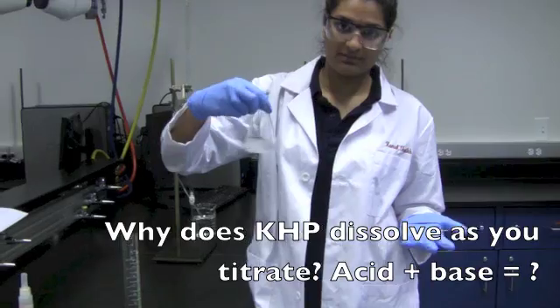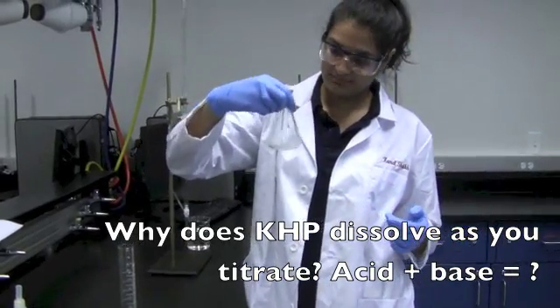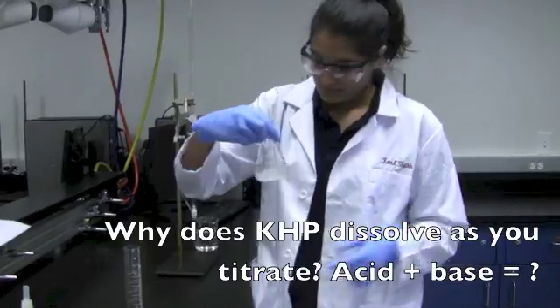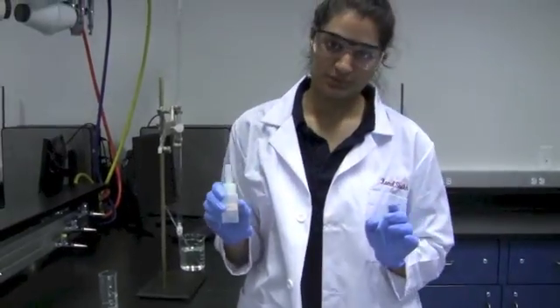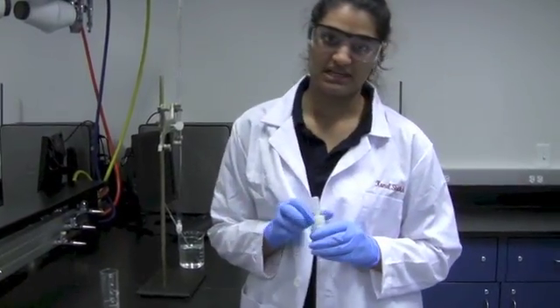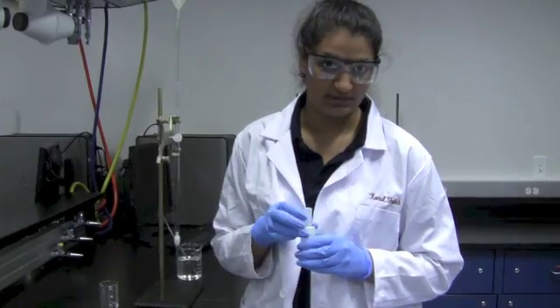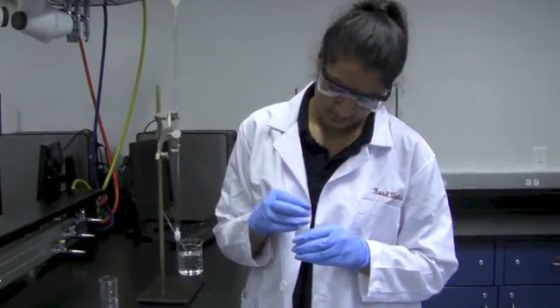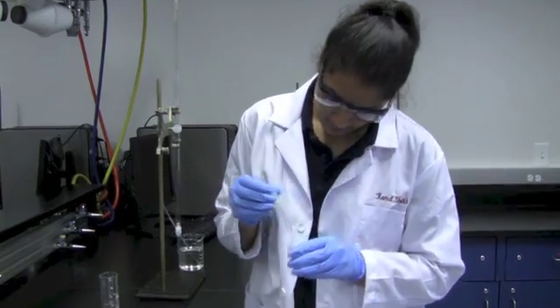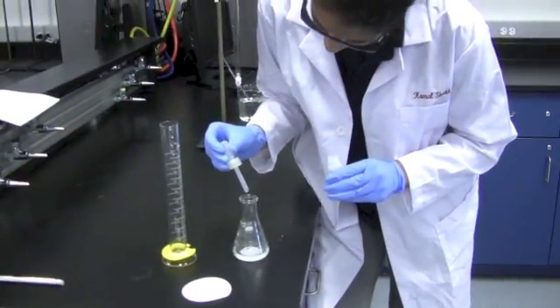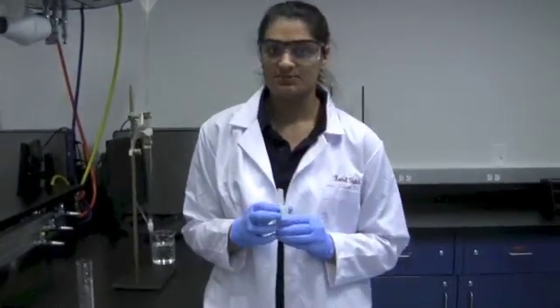However, it will not dissolve completely until you titrate. Your last step is going to be to add the phenolphthalein as an indicator, and this is a very important step, because if you do not add the indicator, then you will not be able to see the endpoint or the color change.